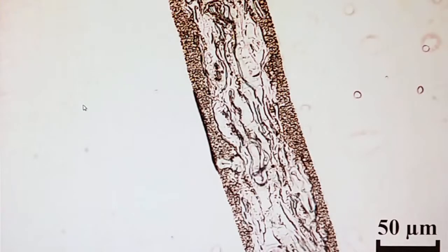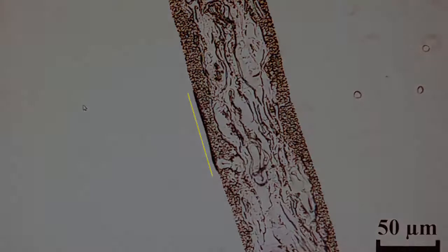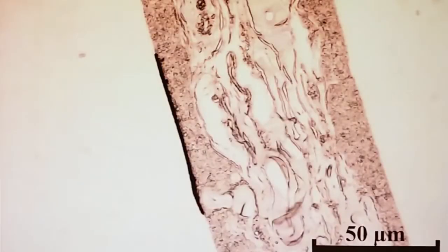You can see when you look at this that the width of the ink is sort of the thickness of the paper, so perhaps 80 micrometer or something. You see, now we have come to 400 in magnification, and now we start to see the height, the thickness of the ink.